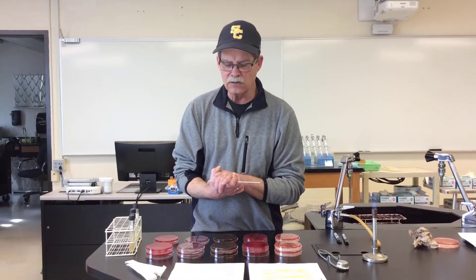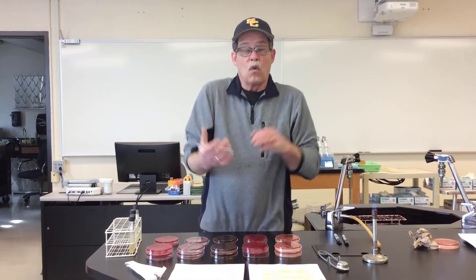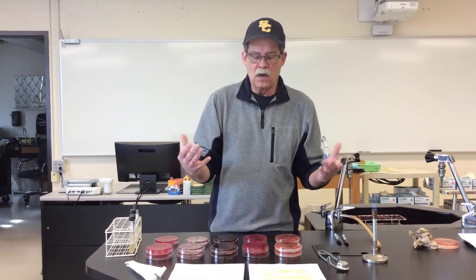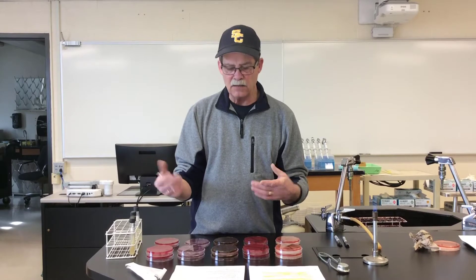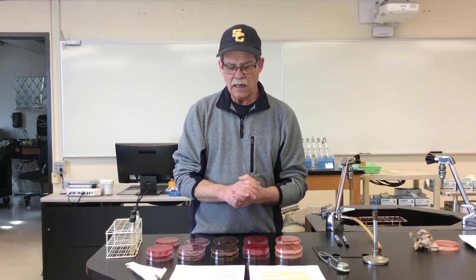Differential media allows the growth of more than one microbe, but with morphologically distinct colonies. They're going to appear different whether or not they utilize a particular growth factor within the media. MSA and EMB would be examples of differential media.